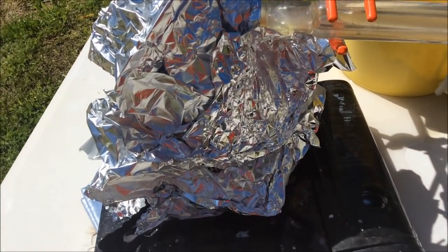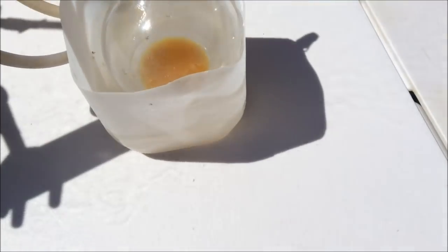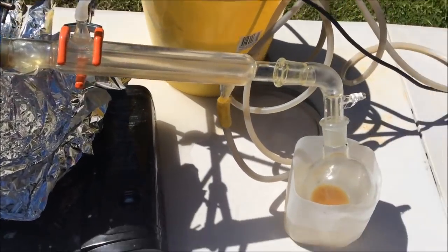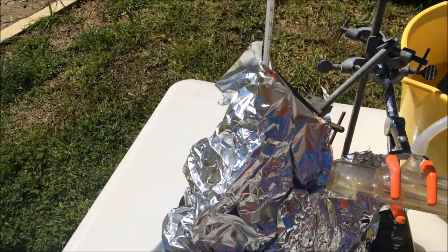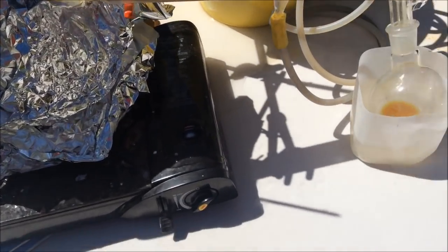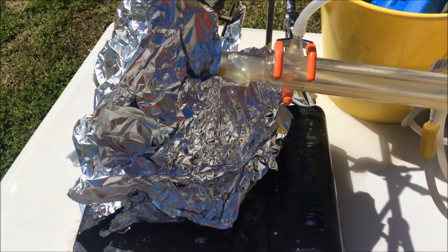All right, I'm really trying to get the last remaining bits out, but it's really not distilling over anymore, which is a bit of a shame because there's really not a whole lot there. I mean, as it's sort of expected, even if we've got 100% yield, it's not a whole lot, but I don't think it's very much in terms of yield. So, I'm going to give up. What's the temperature at? About 150. Obviously, that's way above the benzene boiling point, but we're going to have to turn all the heat off here.